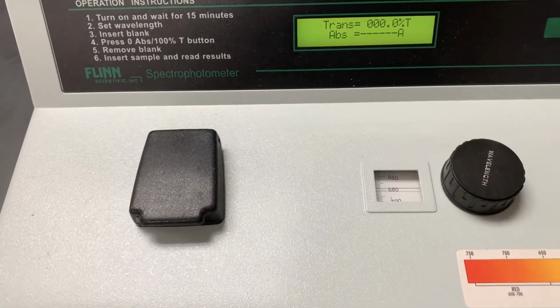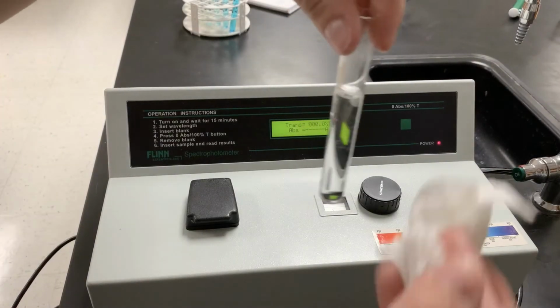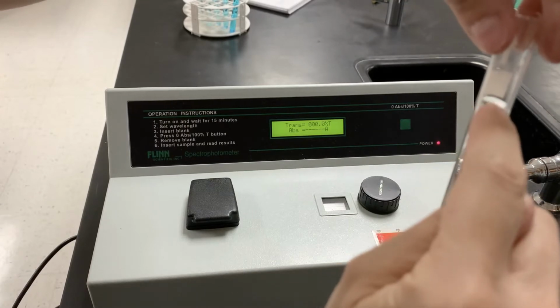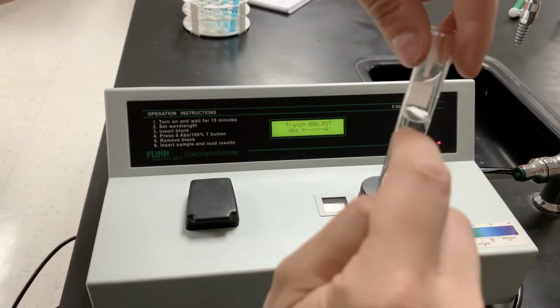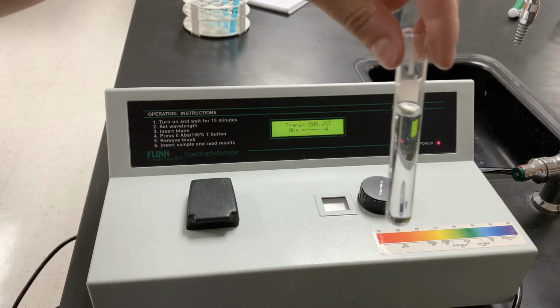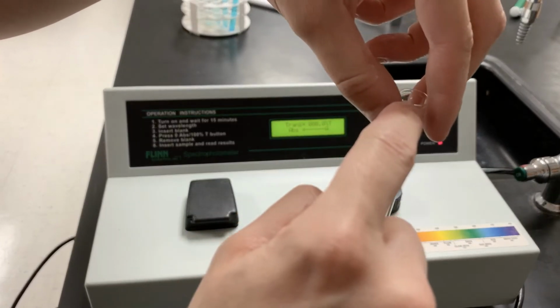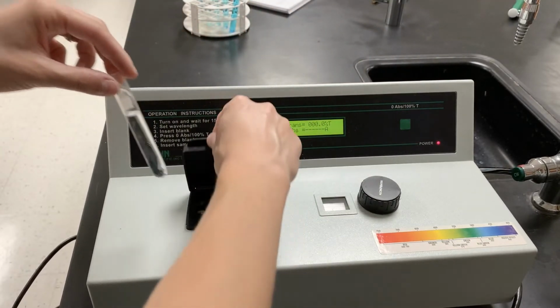Now I am going to zero my spectrophotometer. So I get my water sample here. I'm going to wipe it with a Kimwipe to get rid of any fingerprints. The one thing for you to note: as long as your solution is high enough for the electromagnetic radiation to pass through, it doesn't actually matter what volume you put into your cuvette. So if I hadn't put all of the 8 mLs of solution into the cuvettes, that would have been fine. The one thing you really have to be careful about with your spectrophotometer is to make sure that you don't fill it all the way up to the top, because this is exactly 10 mLs, that it spills over and destroys the spectrophotometer. Okay, so I'm going to put my sample in.